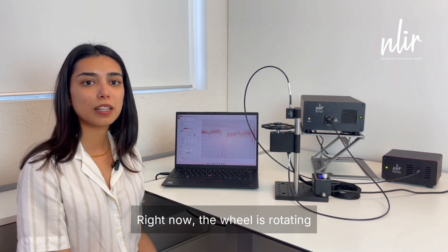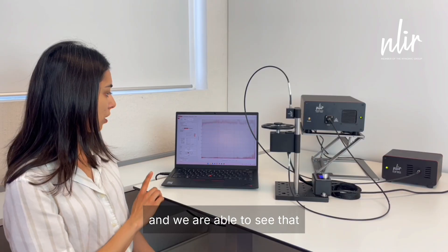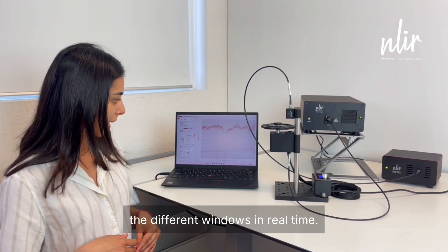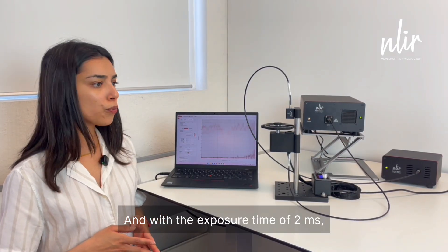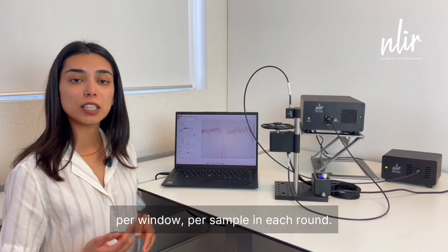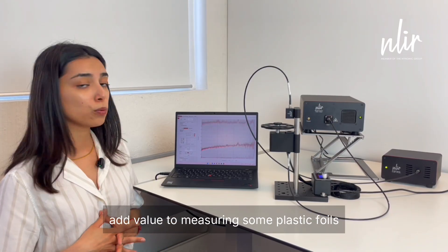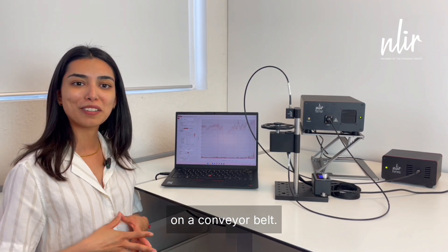Right now the wheel is rotating at a speed of 300 rounds per minute and we are able to see that the spectrometer is able to measure the different windows in real time. With the exposure time of 2 milliseconds we are able to have two to three measurements per window per sample in each round. This is a great example of how this can add value to measuring plastic foils in the industry where the samples are placed tightly together or measuring a large number of samples on a conveyor belt.